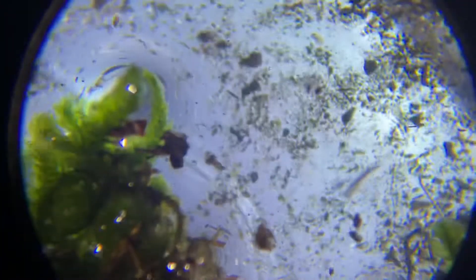What you can do is wiggle this around a little bit. I'm zoomed all the way out — this is about 10x to 15x — and I kind of wiggle it around. They're so tiny you're not going to squish them with this.